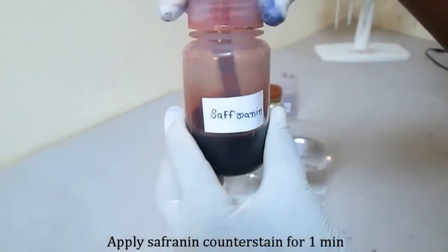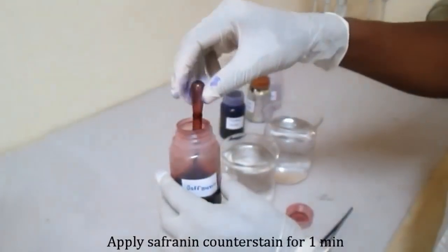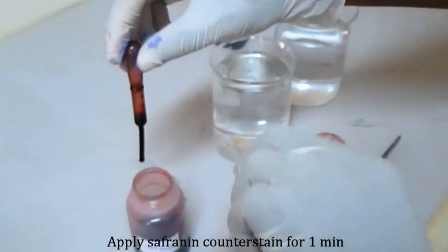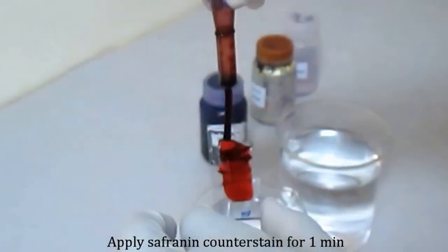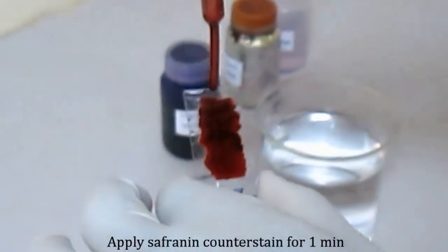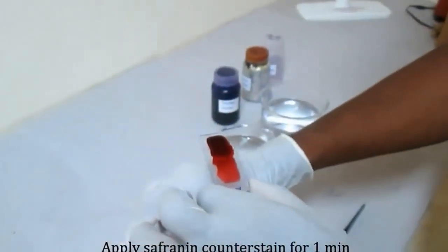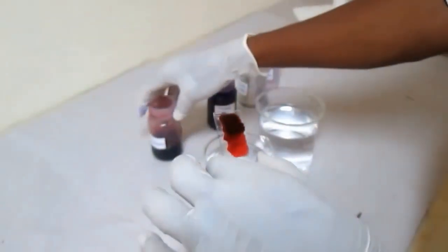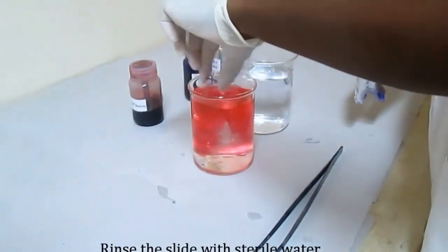Safranin, it is a counter stain. It is red in color. By the application of the safranin, gram positive becomes purple in color and gram negative becomes red or pink in color. Apply the safranin on the smear and leave it for 1 minute. After 1 minute, rinse the slide in the sterile water to remove the excess dye.